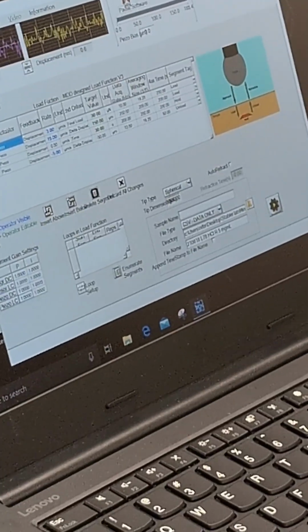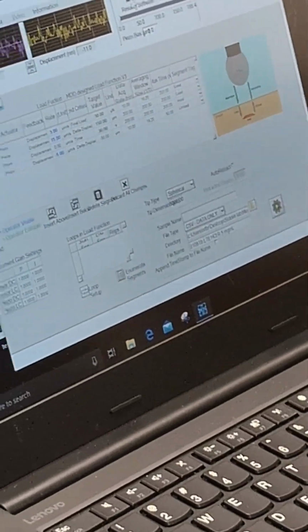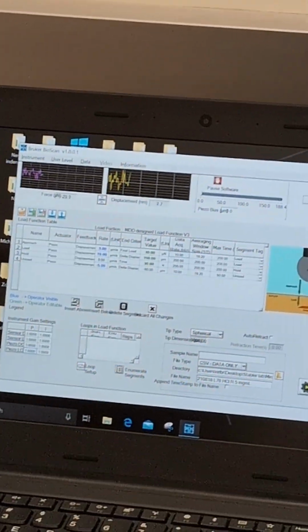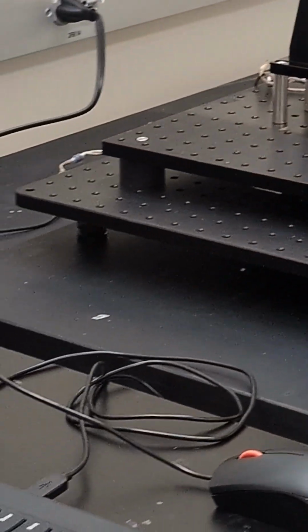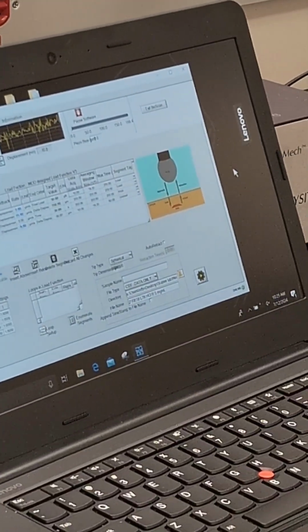I will pause just in case I accidentally touch anything. I'm going to start with the one next to you. It's really, really sensitive, to the point that it actually will record the disturbance. That's another reason you should only operate on this table until you get to the point that you need to operate on this. Minimize anything that can generate any kind of movement. If your cell phone vibrates, it actually will record it.